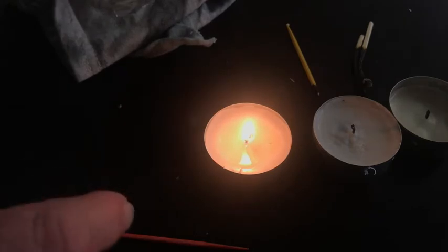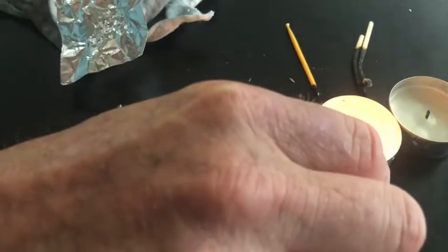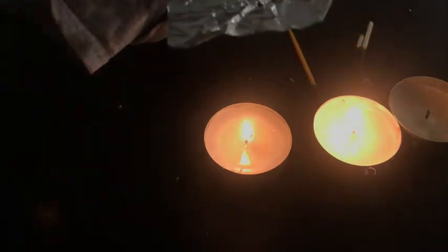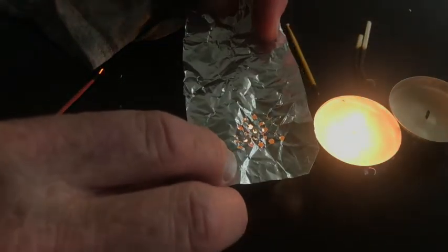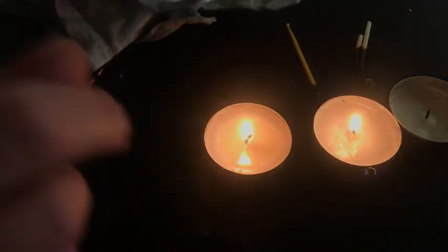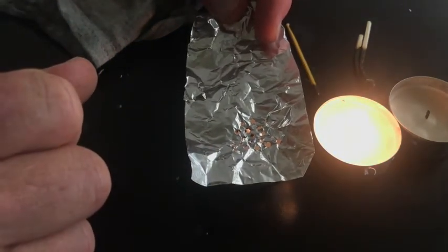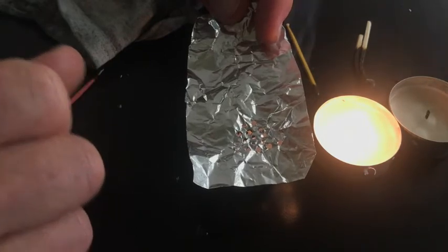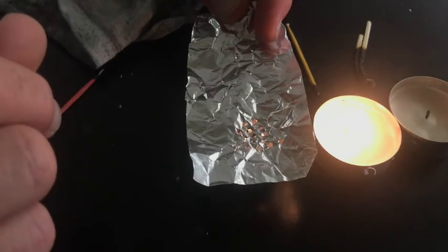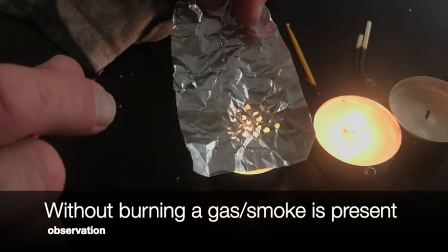Okay, so one of the things that people love, I'm going to light up one of the other candles, because what happens is I often snuff out the flame. So we put this down, and the flame is unable to come through, right? So our first observation is that by going close to the wick, we get this smoke, but we also don't see a flame coming through. So the flame is unable to get through, even though clearly things are passing by.